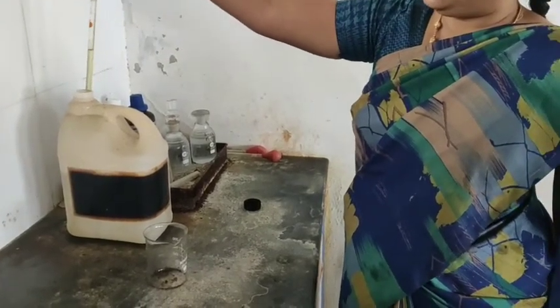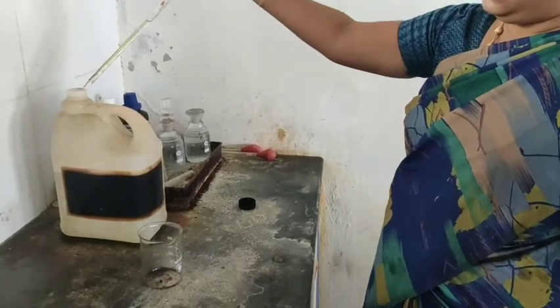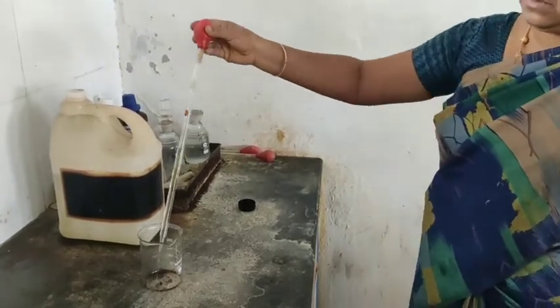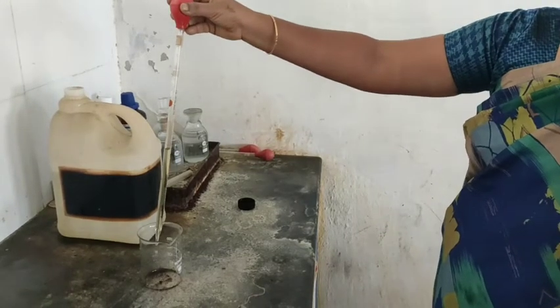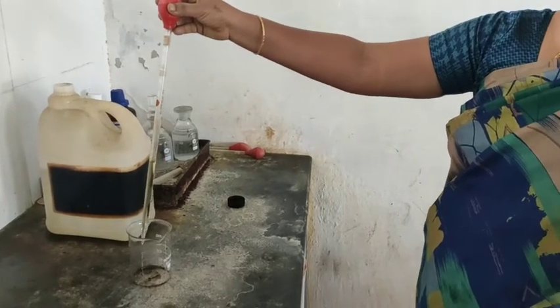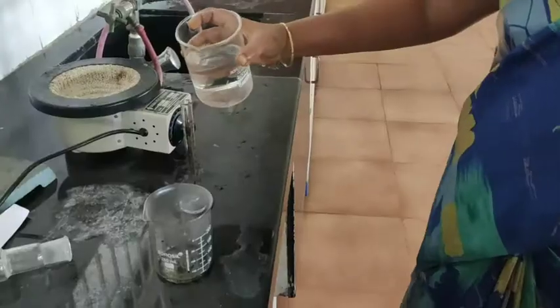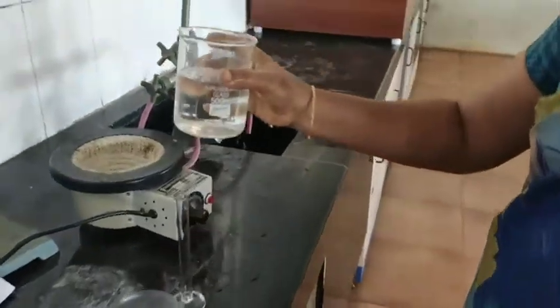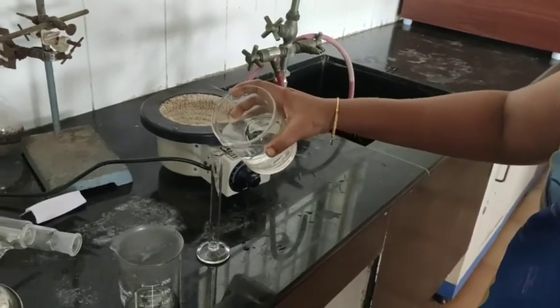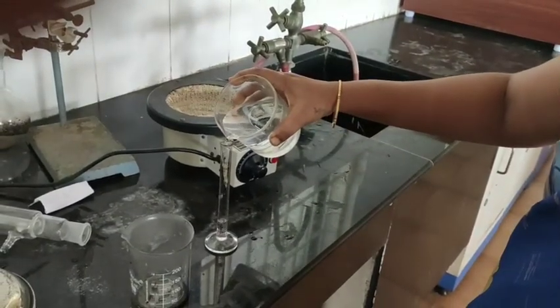It is completely heated and now completely dry. We have to add 6 ml of HCl and 5 ml of water to this dried extract. The 6 ml of acid has been added, and 5 ml of water is being measured and will be added.